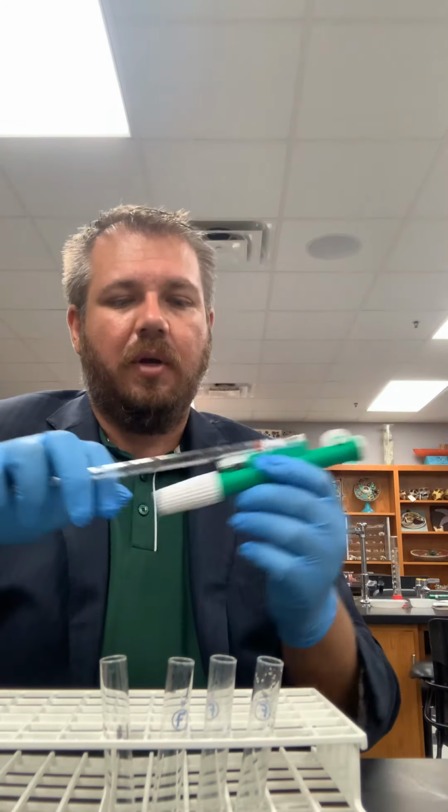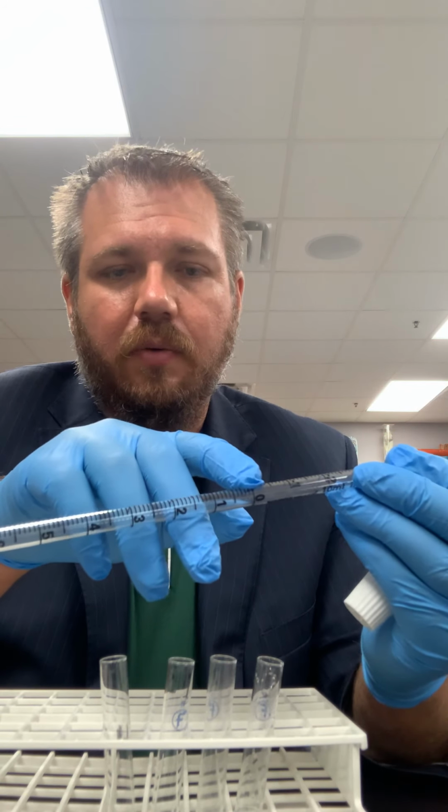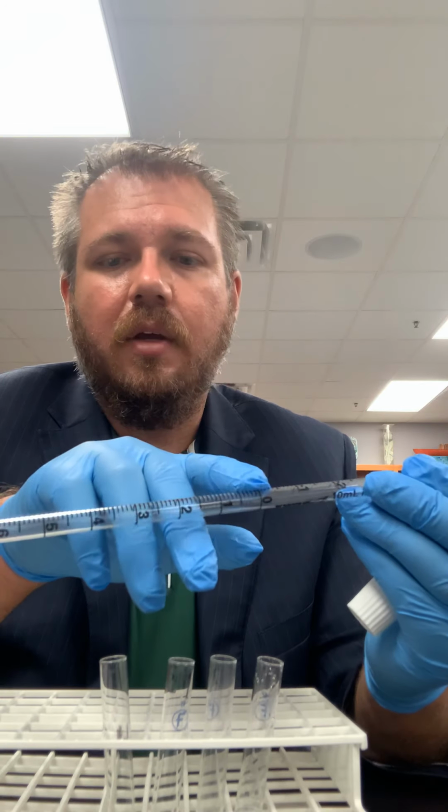So in this section also you're going to use these other pipettes. So instead of using the transfer pipettes, you're now going to use the graduated pipette. So the graduated pipette allows you to have an exact amount that you're pipetting. And you'll notice there are two measures on it. So on one side it's going to count up in volume, and on the other side it's going to count down in volume. So this allows you to do two different things. If you want to, you can draw up, say, 10 milliliters, because this is a 10 milliliter pipette. You could draw up to 10 milliliters, which is going to have you up here at the 0. And if you wanted to dispense 4 milliliters of liquid, you would go down to 4. So you've dispensed 4 milliliters of liquid.